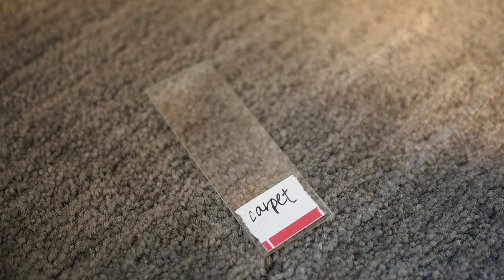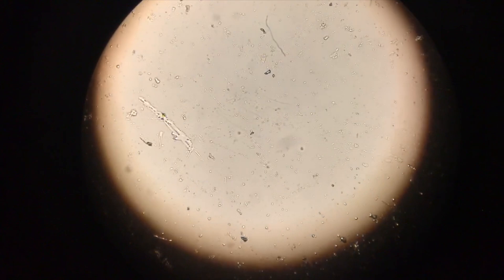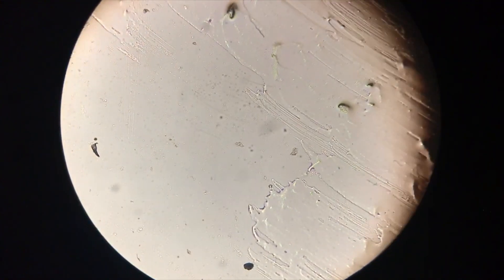Finally, we tried to sample our carpet. As you can see, the slide from the carpet showed a little bit of dust as well as some of the fibers from the carpet itself.